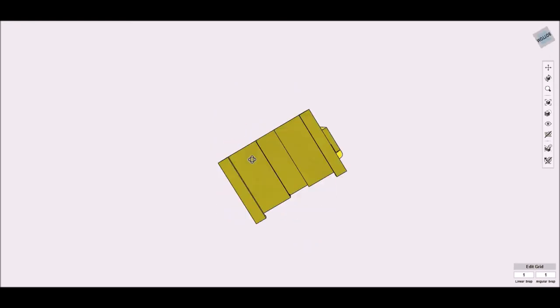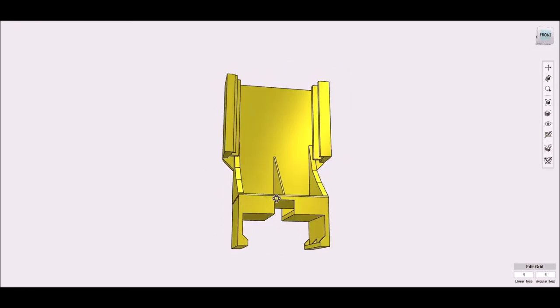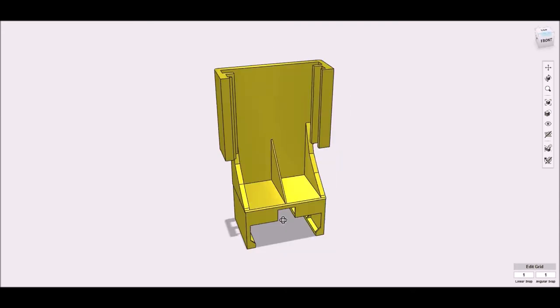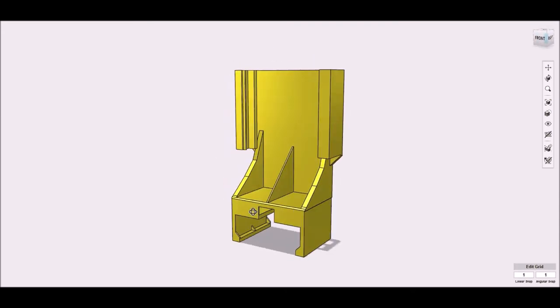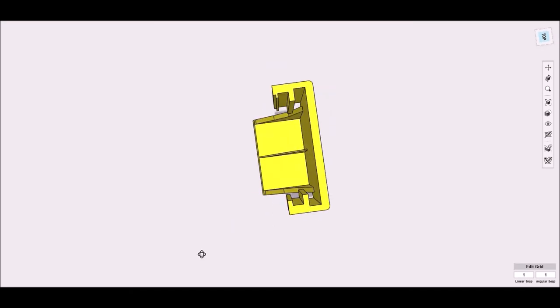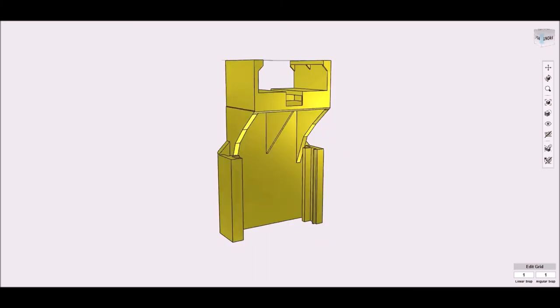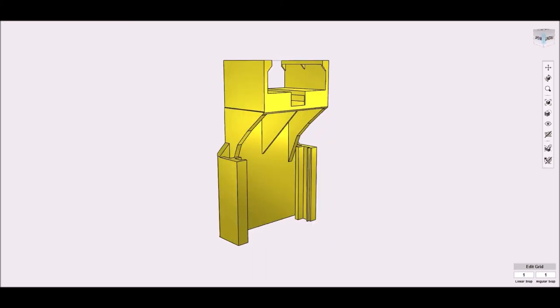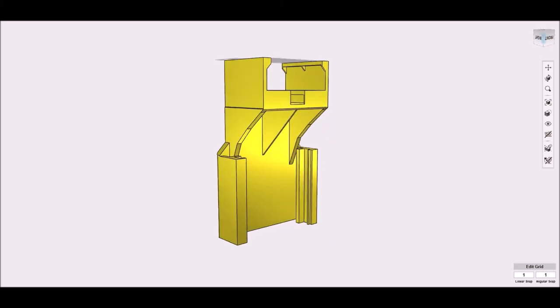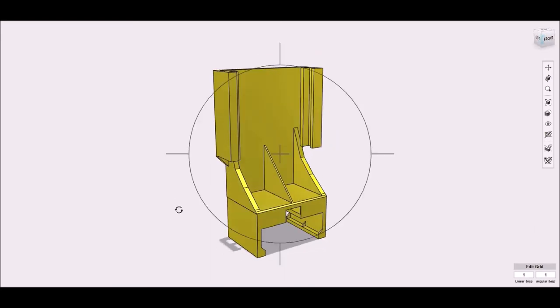The bottom section clamps securely onto the lens bracket, also with no screws. There are a few little gussets that get removed after printing, but they allow the print job to proceed without further support. The Raspberry Pi stands over an inch above the lens bracket. This leaves room for the microSD card to be inserted, and there's even room for a little channel to route cables.